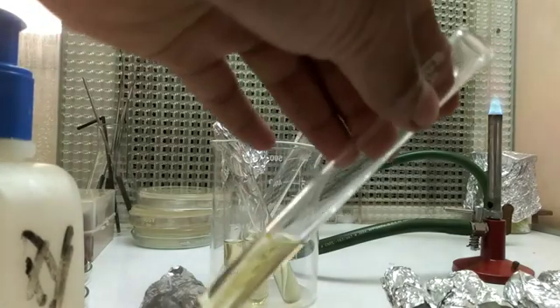After inoculation, incubate all the nutrient broth test tubes for 24 to 48 hours. After incubation, the test tubes inoculated with E. coli show turbidity — you can see a lot of cloudiness. The control test tube marked 'C' shows no turbidity at all. By comparing both, you can identify that growth has taken place in the inoculated tubes but not in the control.